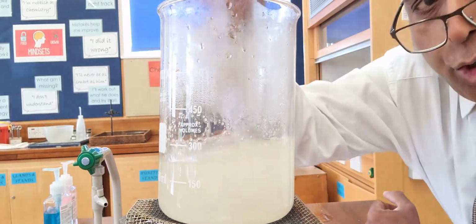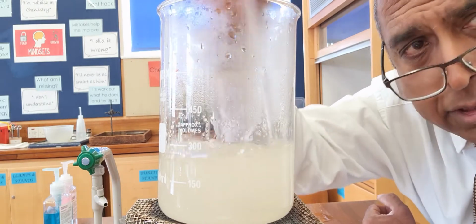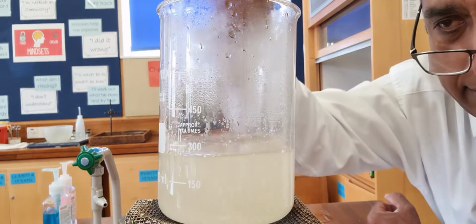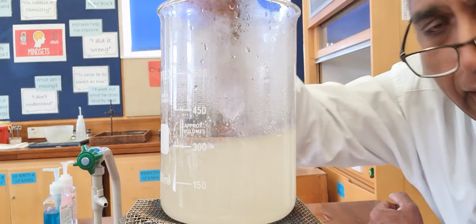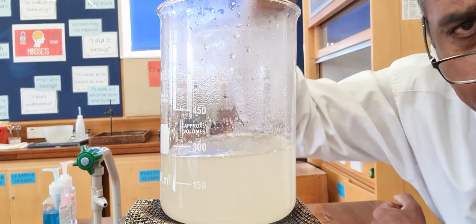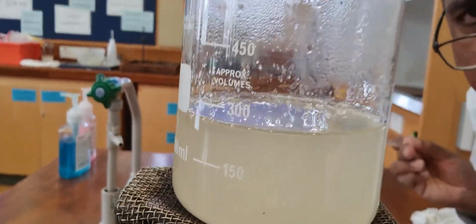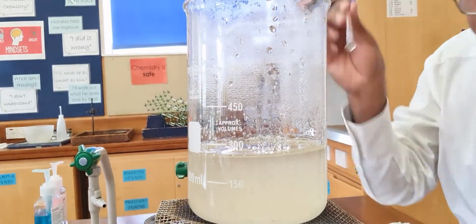And the reason I put 40 in is I think I won't be able to get 40 to dissolve. I think with 40 it will stay opaque. Look, you can't see through that. That is not clear. That is not transparent.